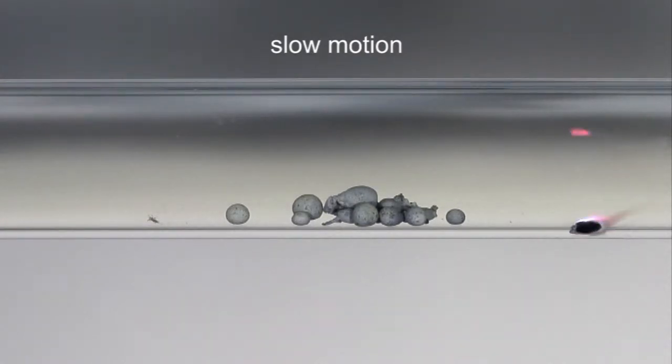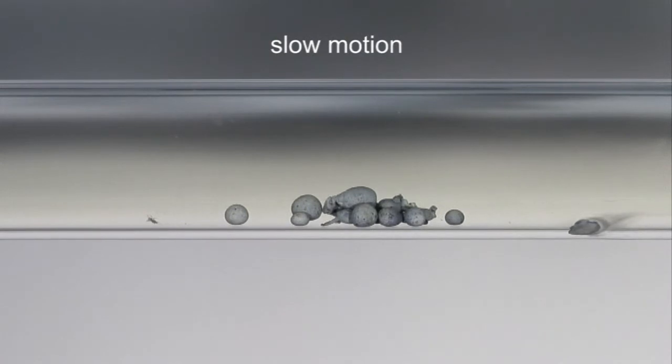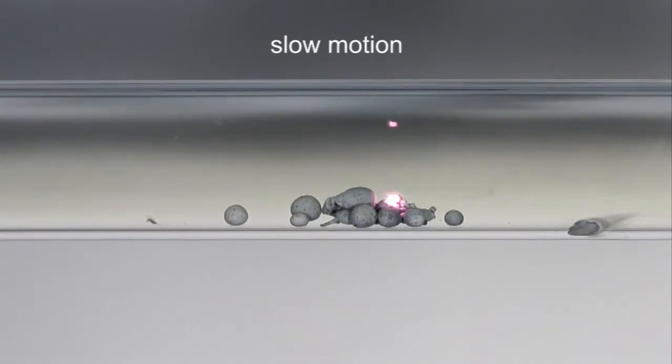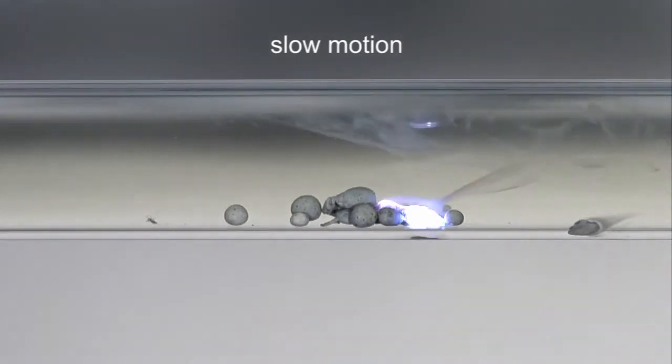The reactivity of potassium is exemplified by a spontaneous and rapid reaction with chlorine.